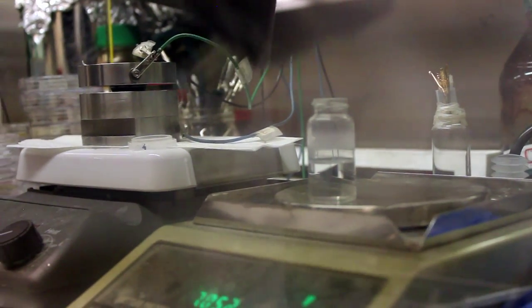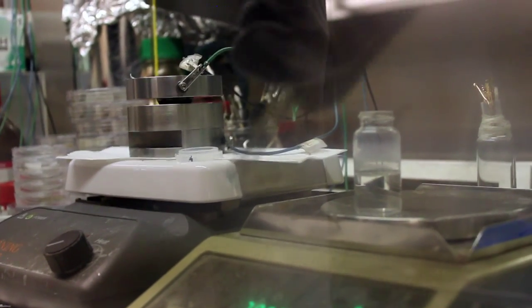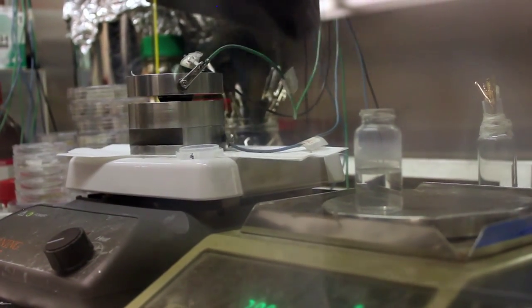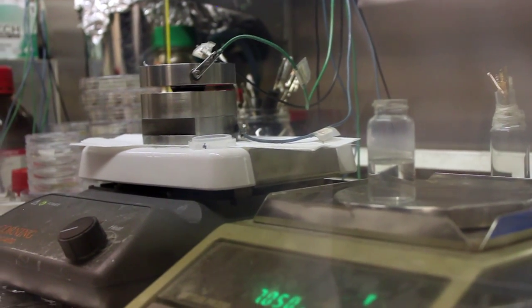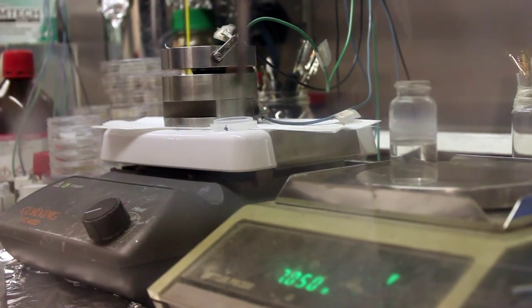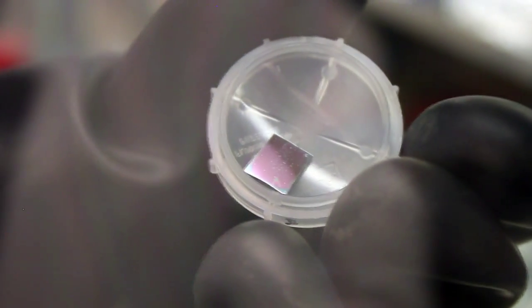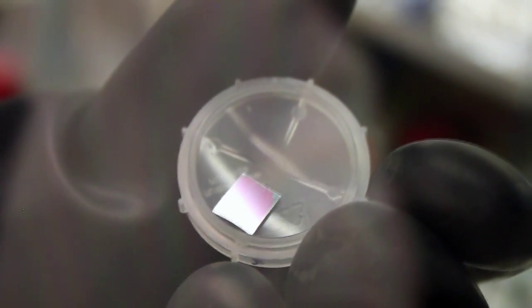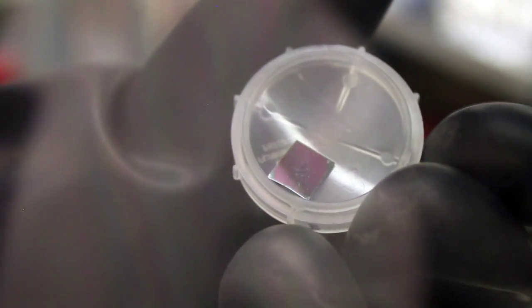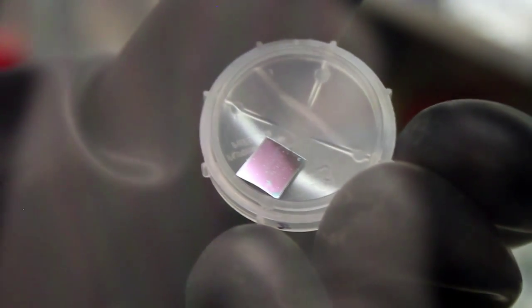We wait for the hexane to dry off, shaking the sample gently and waiting for it to dry. The sample should look very clean with no white stains on it. Once it looks clean, the sample is ready to be taken out of the glove box.